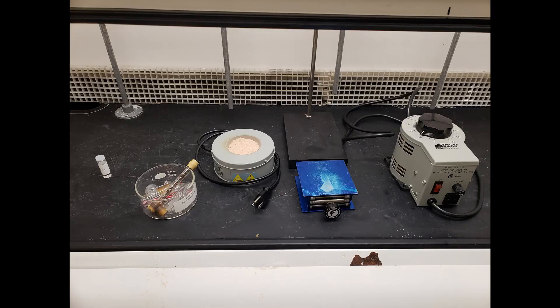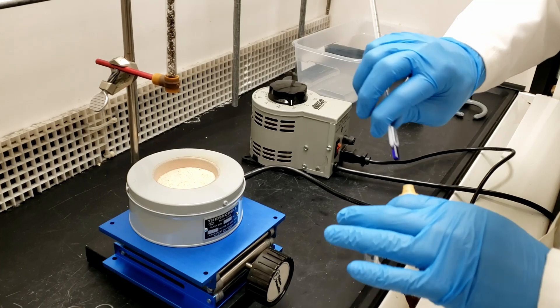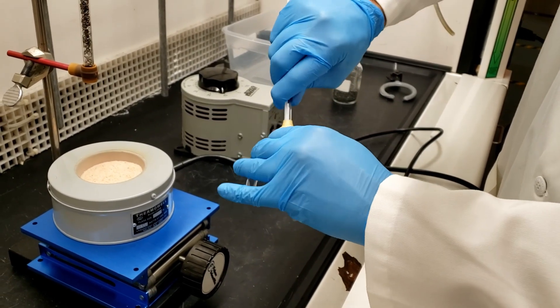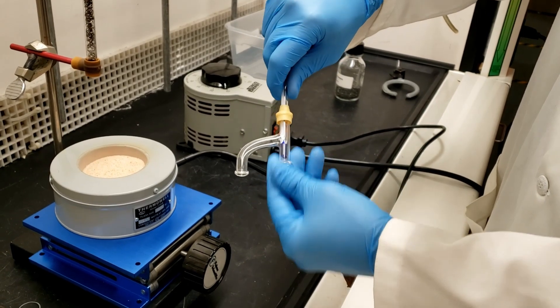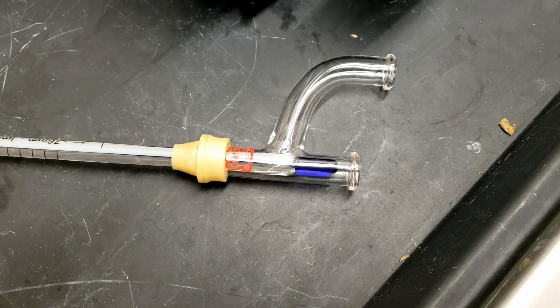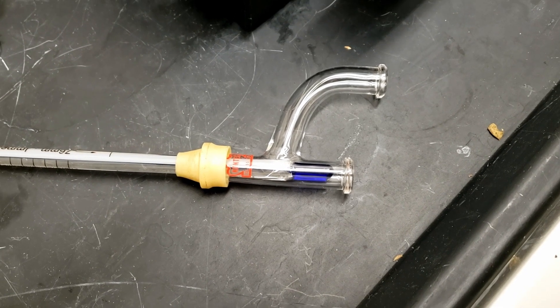We will now begin the fractional distillation portion of the lab. A microscale glassware set has been provided. Assemble your distillation apparatus and take extra caution when inserting the thermometer through the septum. Hold the thermometer an inch from the end and twist to insert. Make sure the thermometer bulb sits just below the sidearm to ensure an accurate boiling point reading.